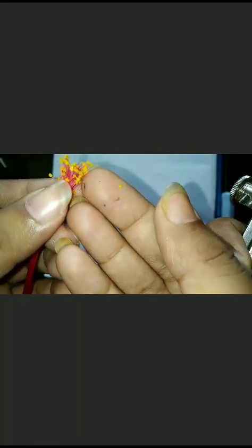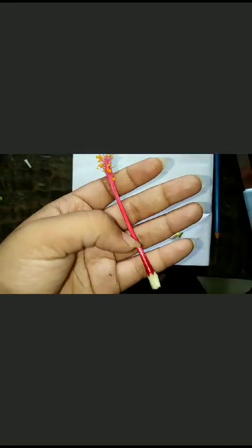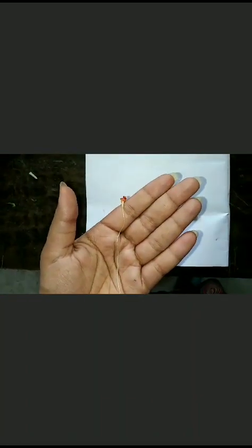Now we are moving to the gynoecium part. The red head of the gynoecium, and this is the ovary, and this is thalamus. The white tube is called the style, and the red head is called stigma. Now we are going to cut the ovary of the flower.